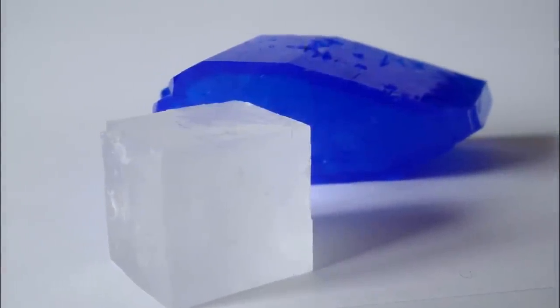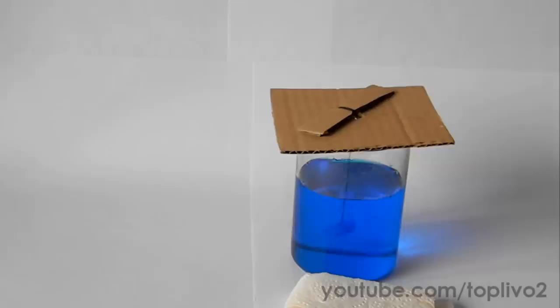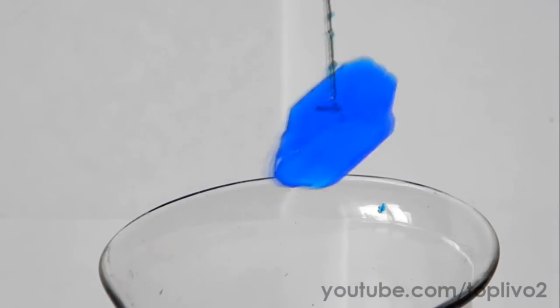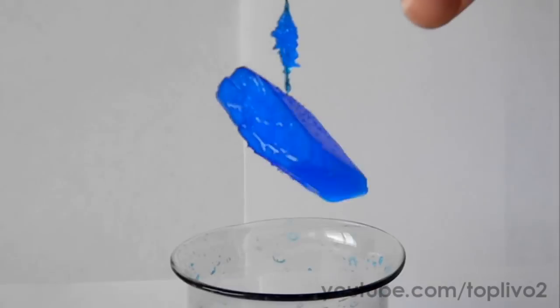Hello everyone! Today we'll grow some crystals again. As in the previous video, I will try to describe the whole process of growing the crystals to you.